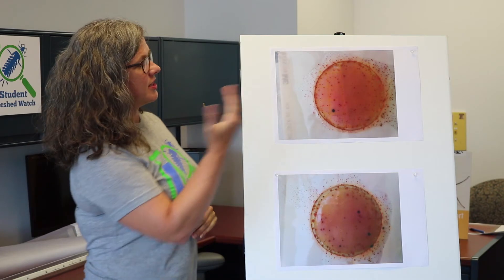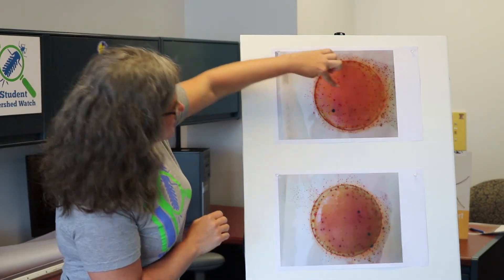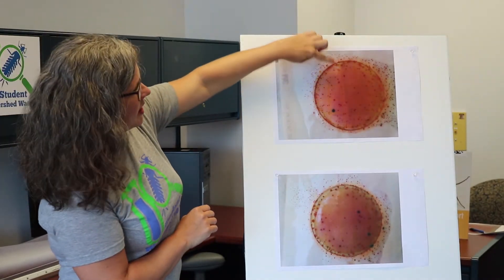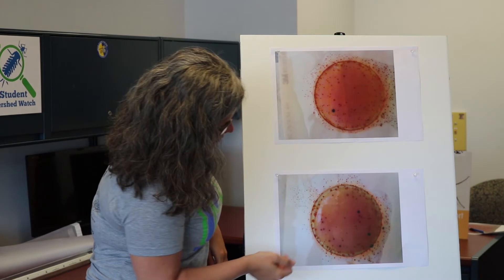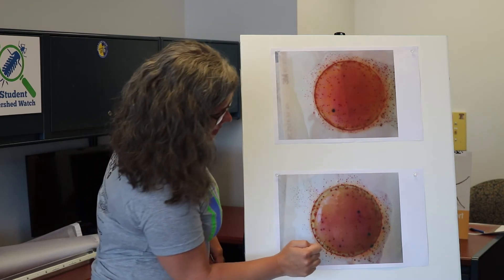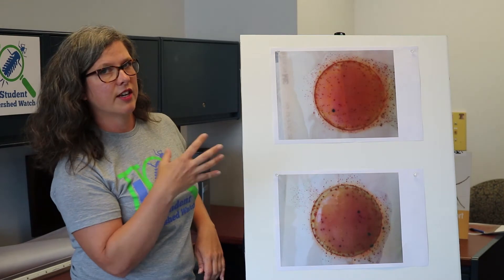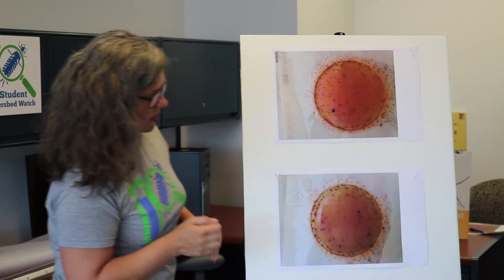For instance, in this top photo, we have two true E. coli colonies. There is one outside of that area, so we don't count that. On this bottom one, we have a few more — one, two, three, four that I would count. This one is at least half outside of the circle, so I wouldn't count that, and definitely not these for the E. coli.